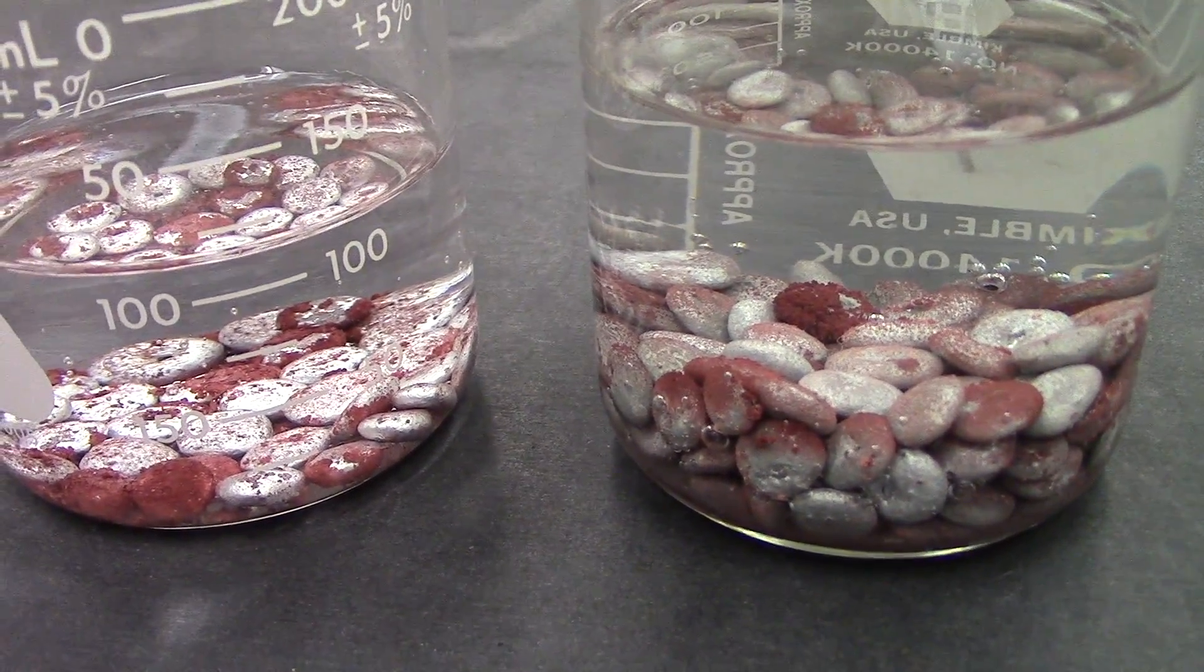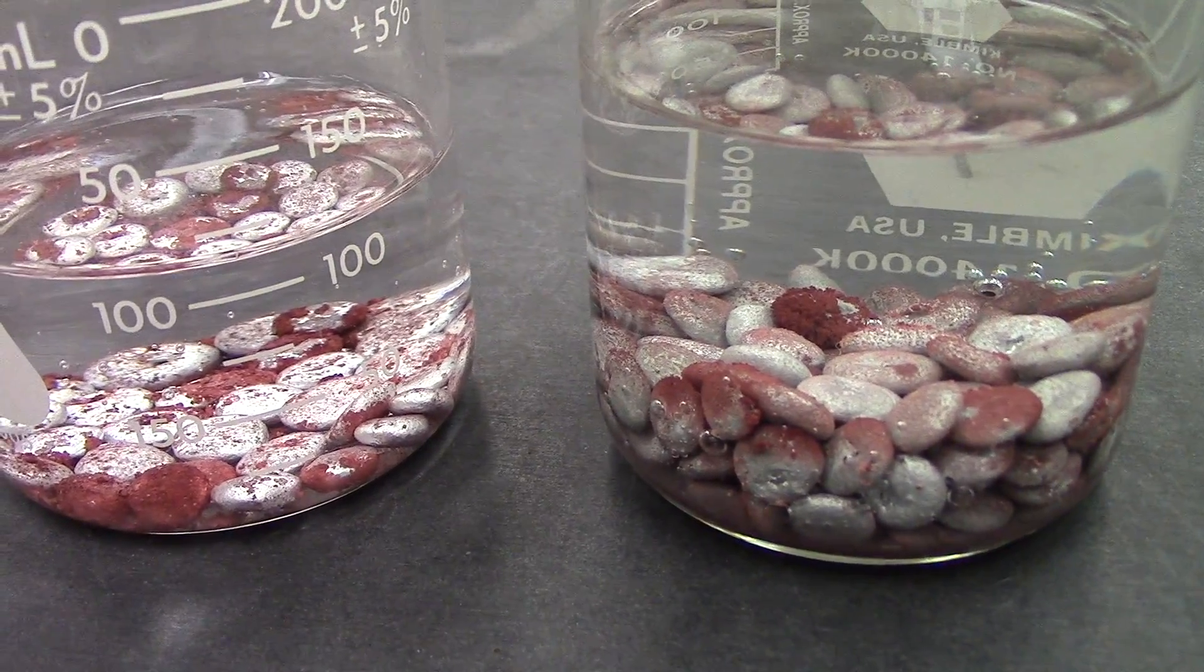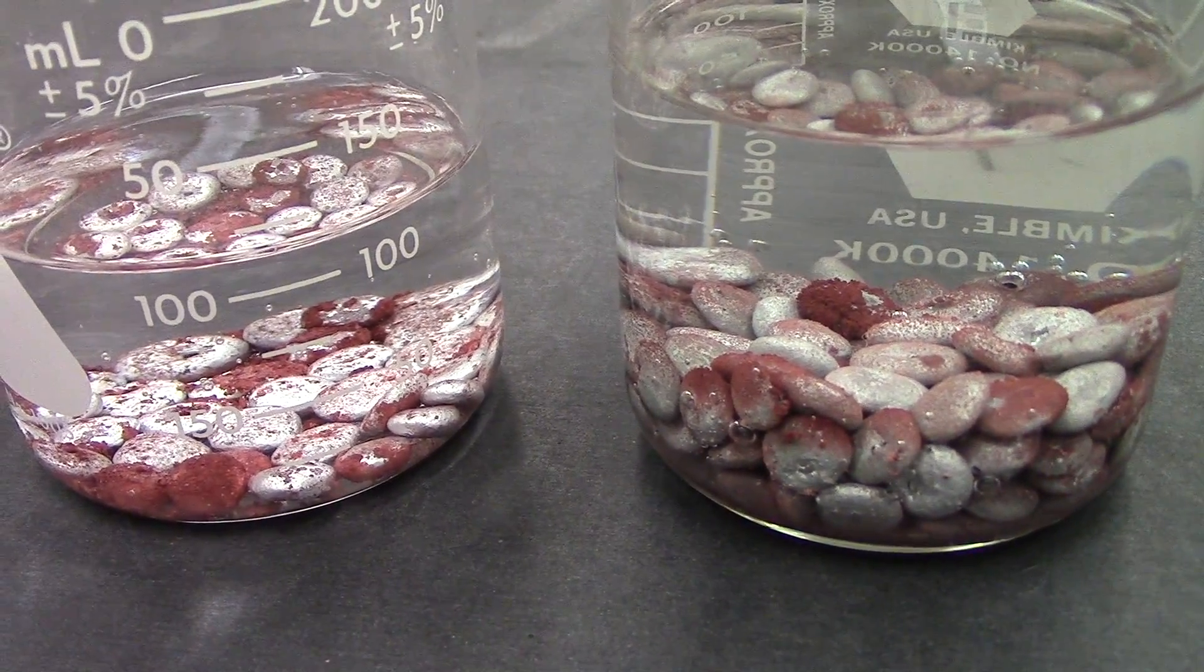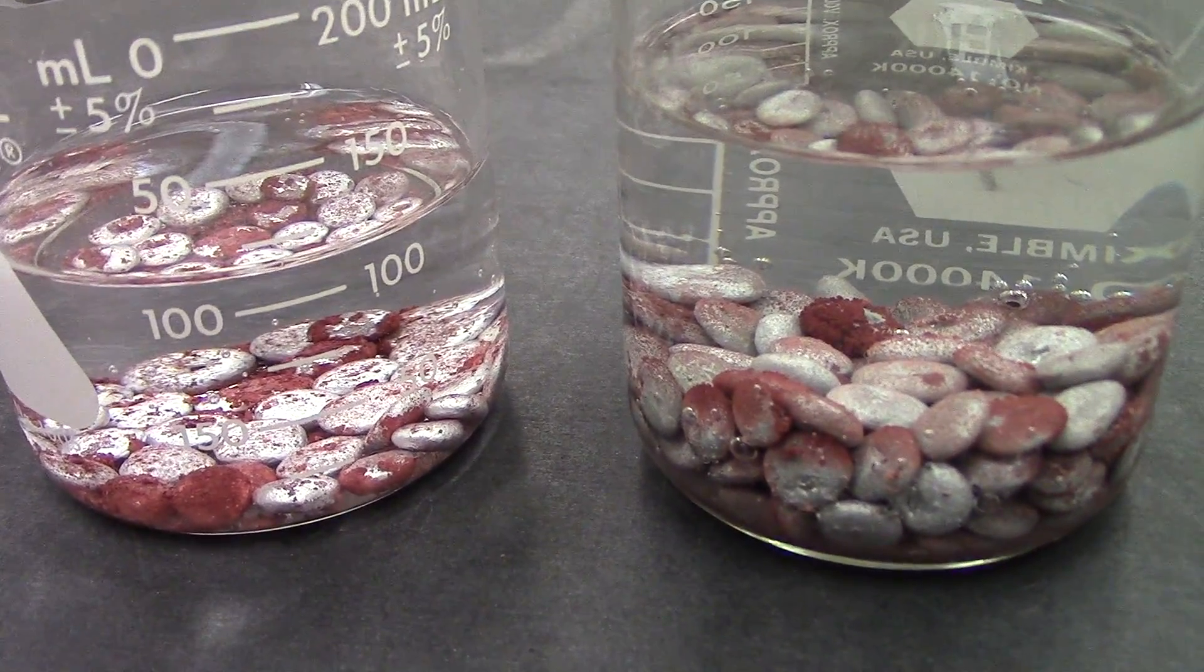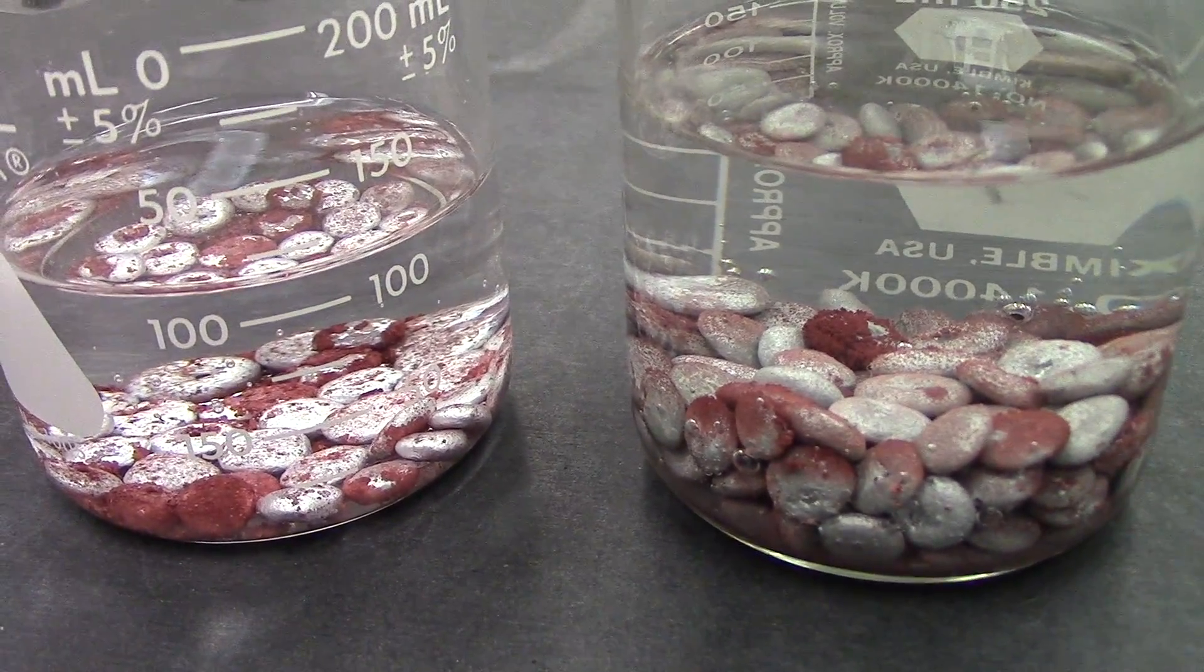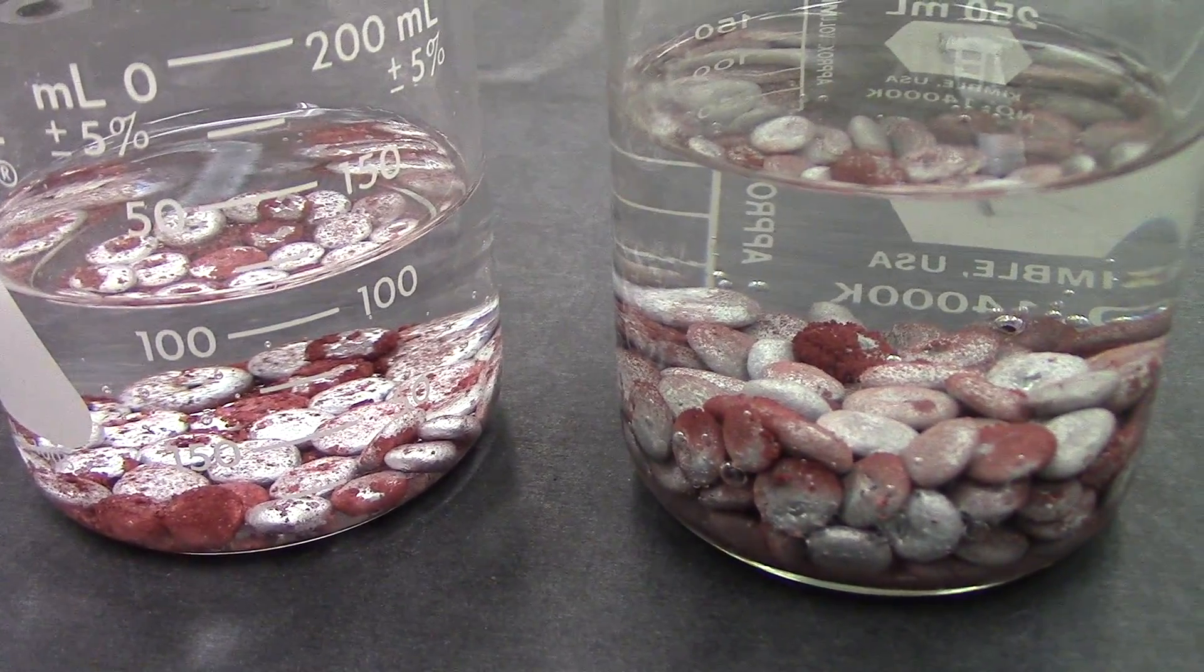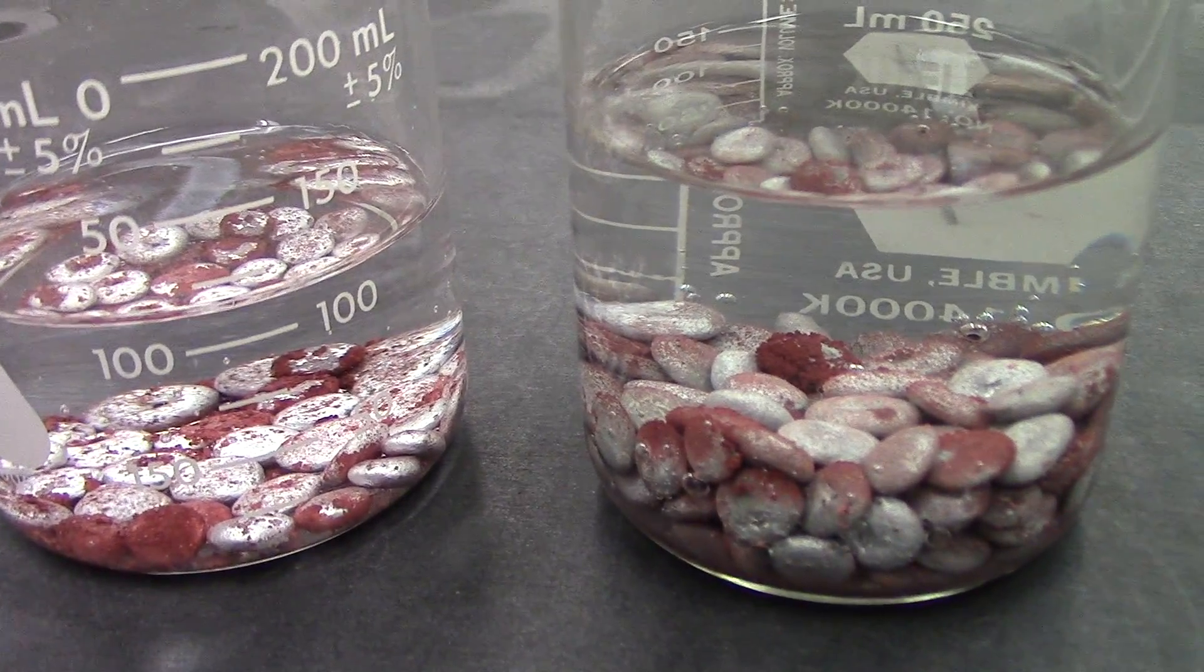You can tell, having them side by side, that the one on the right, the room temperature one, still has a way to go before the reaction goes to completion and all of the copper has been pulled out of solution and deposited on the aluminum.